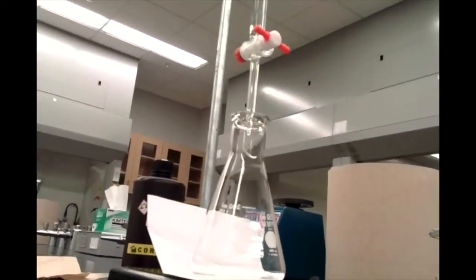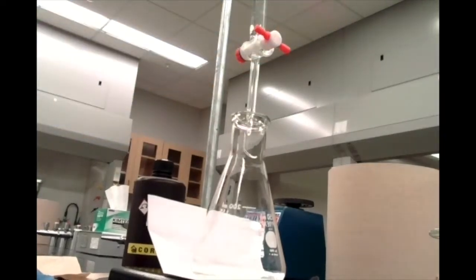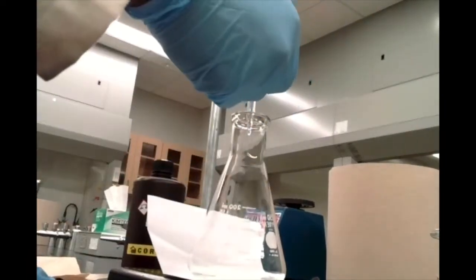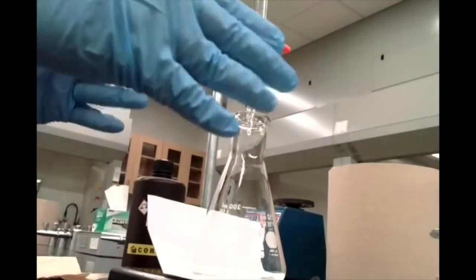All right. So typically, the way you handle a titration is, this is set up so that if you're right-handed, you've got the readings over here in front of you, of course. You use your dominant hand, and in this case I'm right-handed, to control the stopcock. That way I have a little bit more control for turning it on and off.